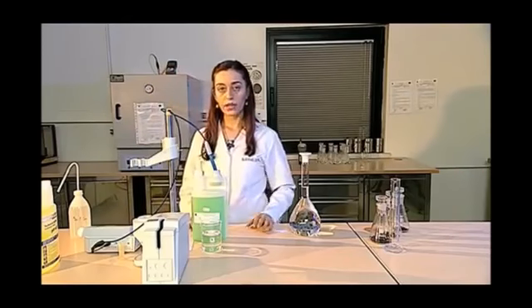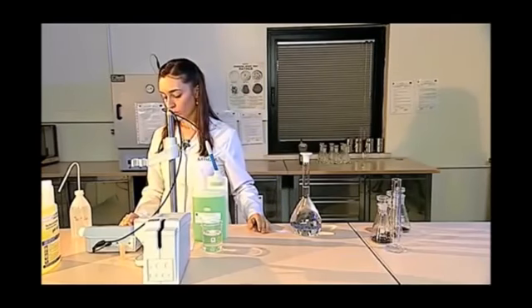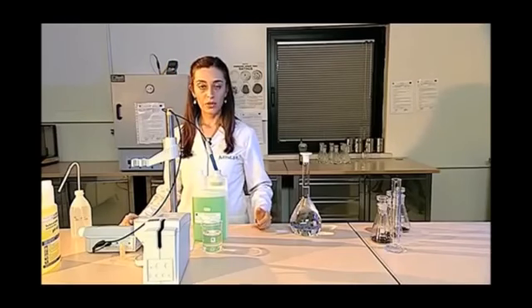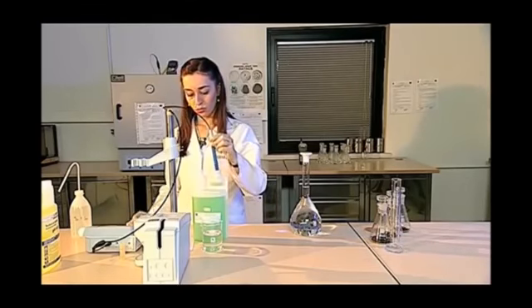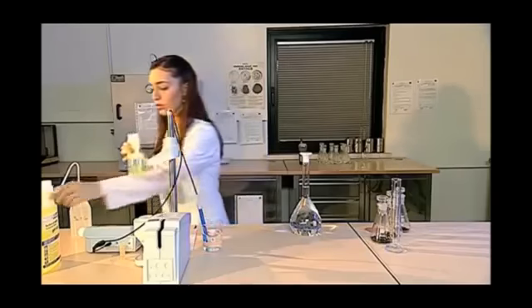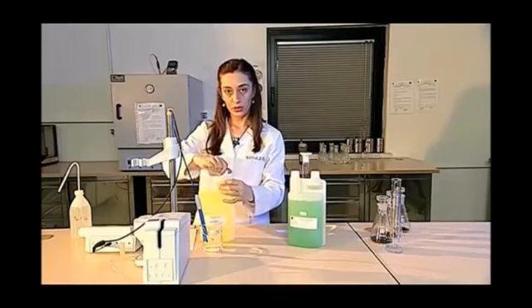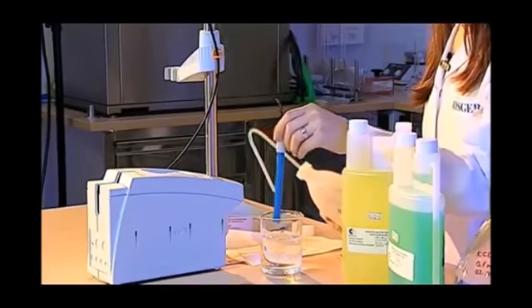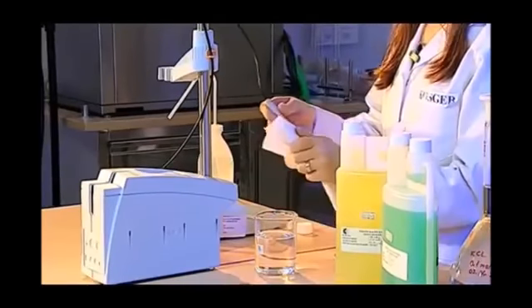First, we find the asymmetry value in the pH meter. The measurement is completed when the pH is fixed. We compare the value we see with the table value and decide that there is no problem with the calibration of the pH meter if the value is between the value range. I stop it when it is fixed. Then I get the pH 4. The priority should always be given to the pH 7 in the calibration process, for this process provides neutralization of the pH meter. If our work range is with alkaline samples, then we use pH 7 and pH 10.